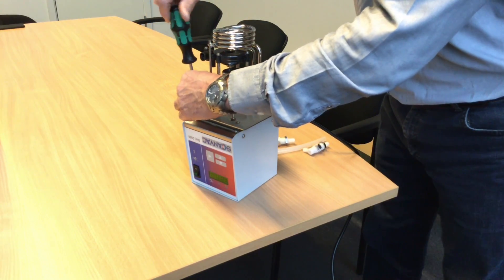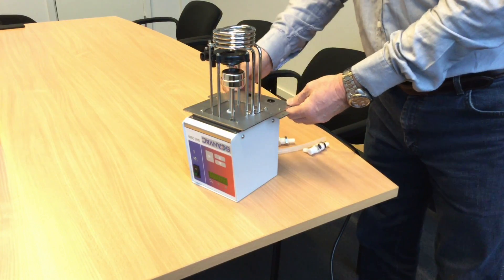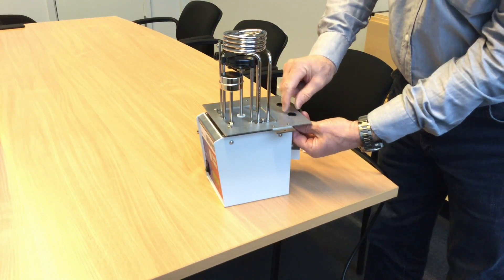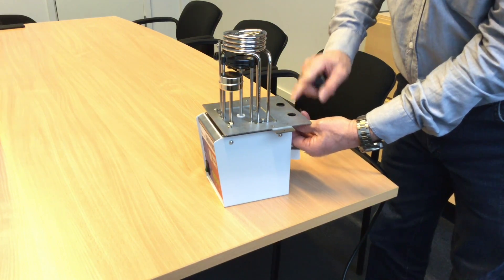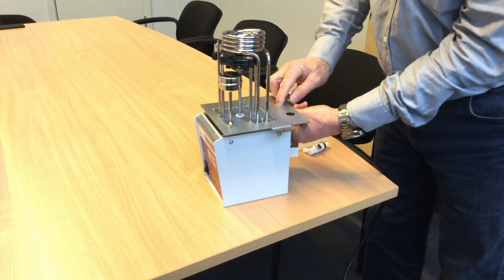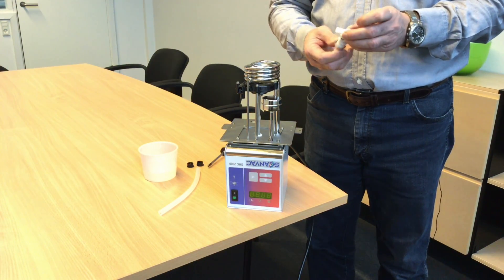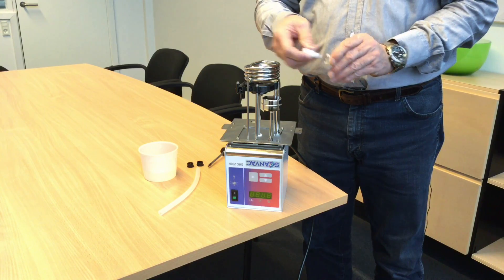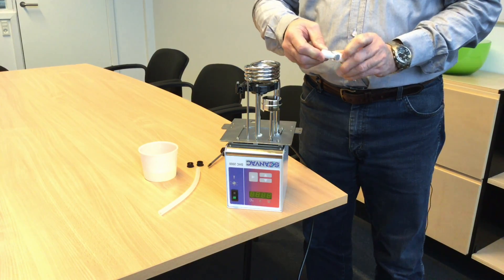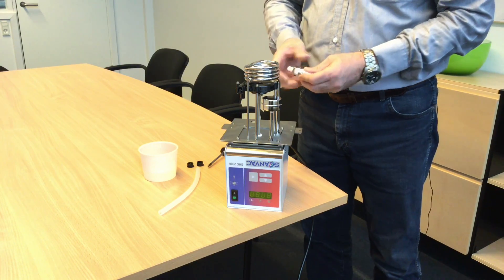Now the bridge is mounted correctly on the thermostat. At the back we have the black knob which you can remove with a small screwdriver — squeeze it out. There are some small taps so we can take those out. Now we shall connect the external circulation kit. A small trick here is you can press this one and bring it out, so you can easily connect and disconnect for the external circulation when you are in operation.